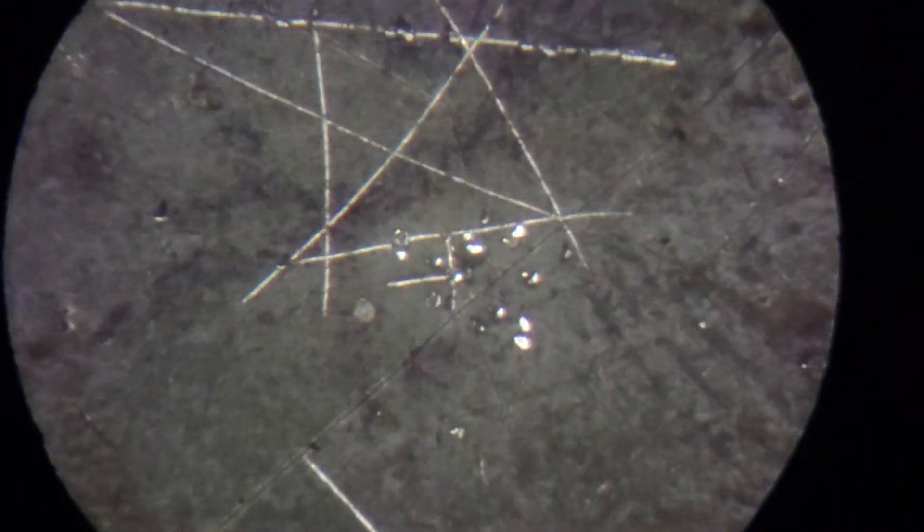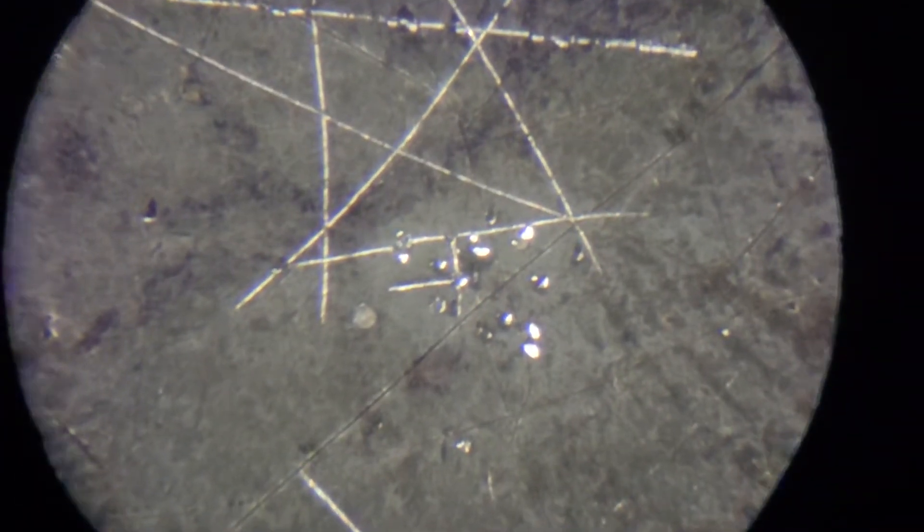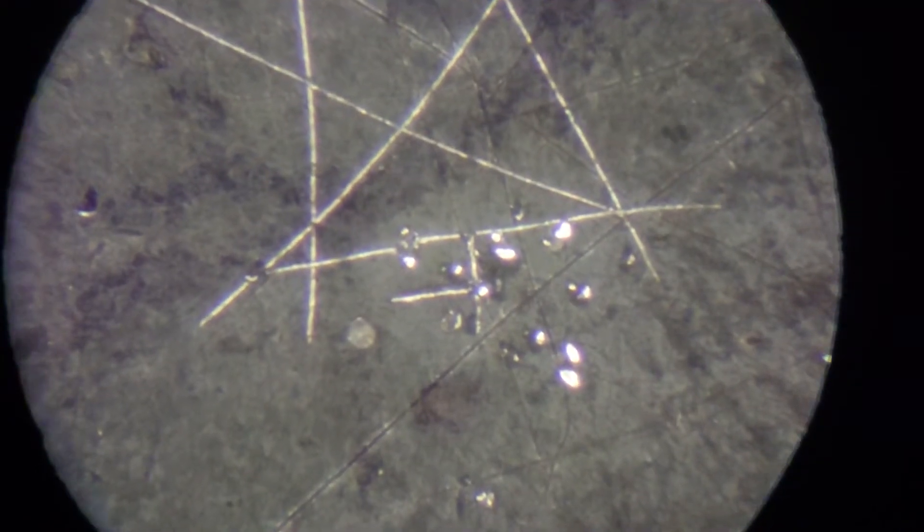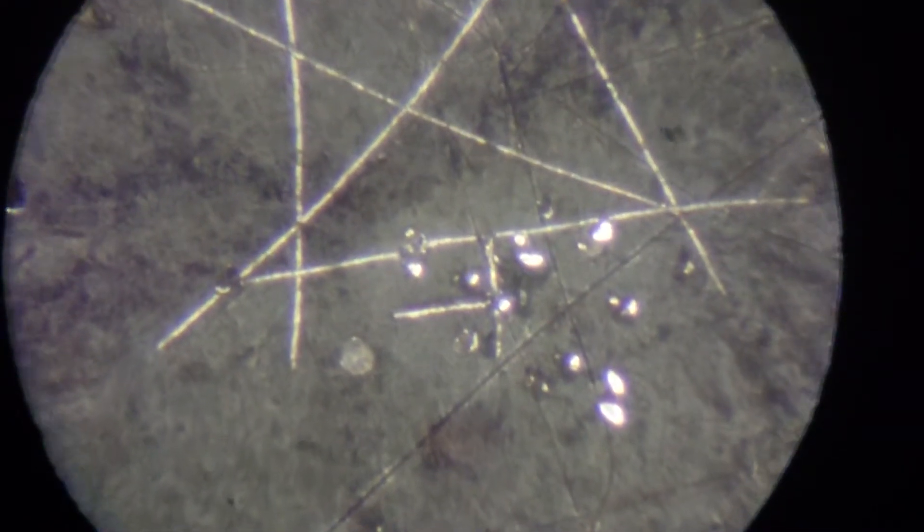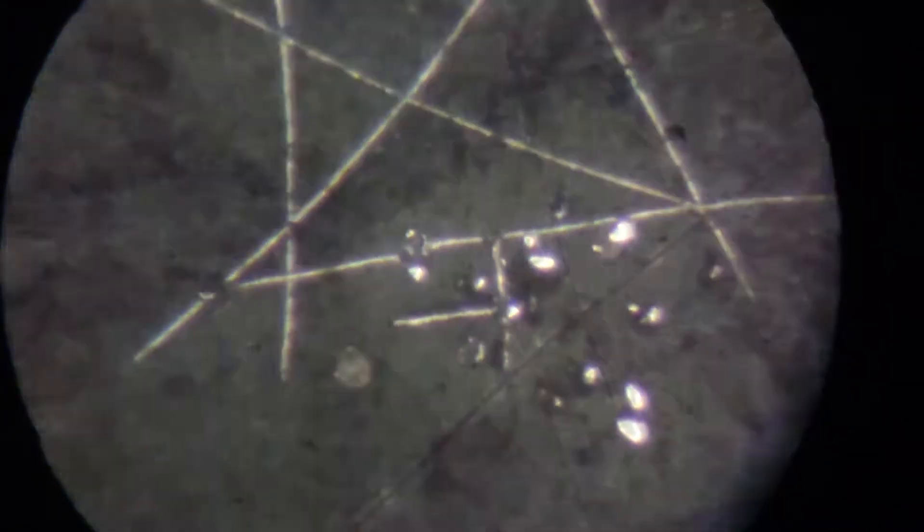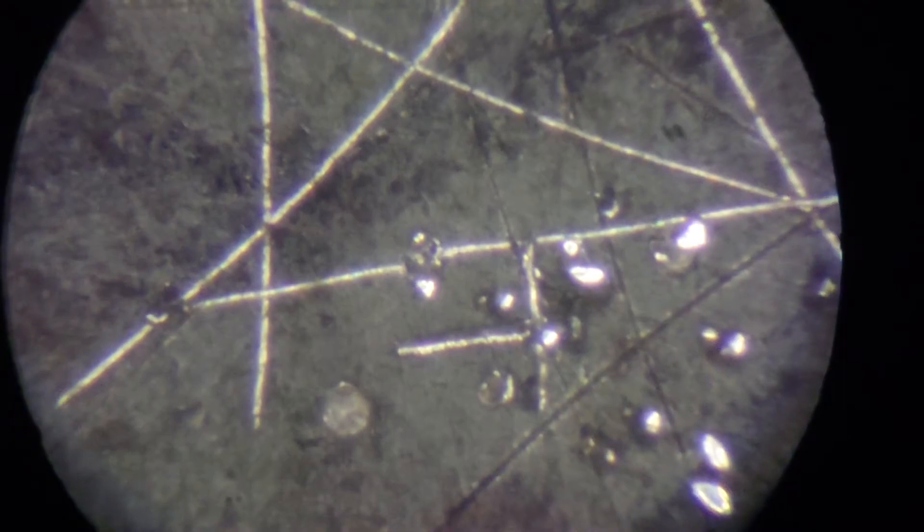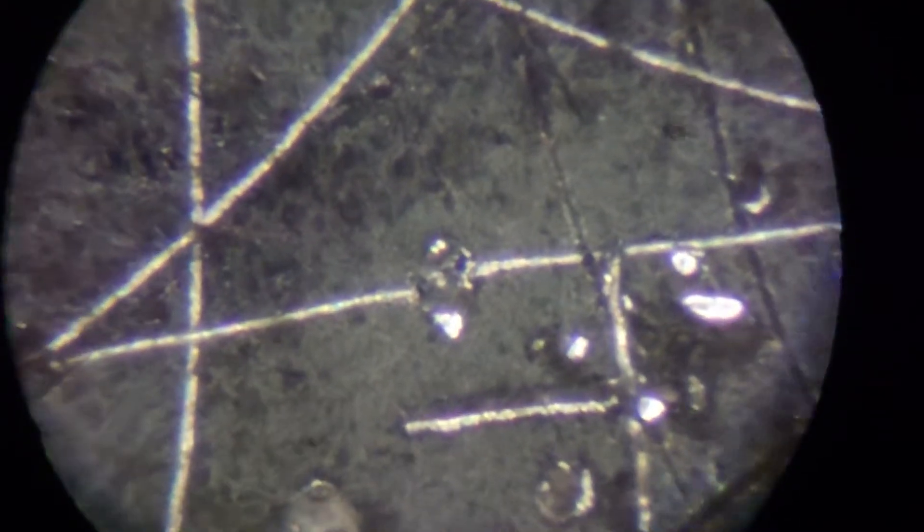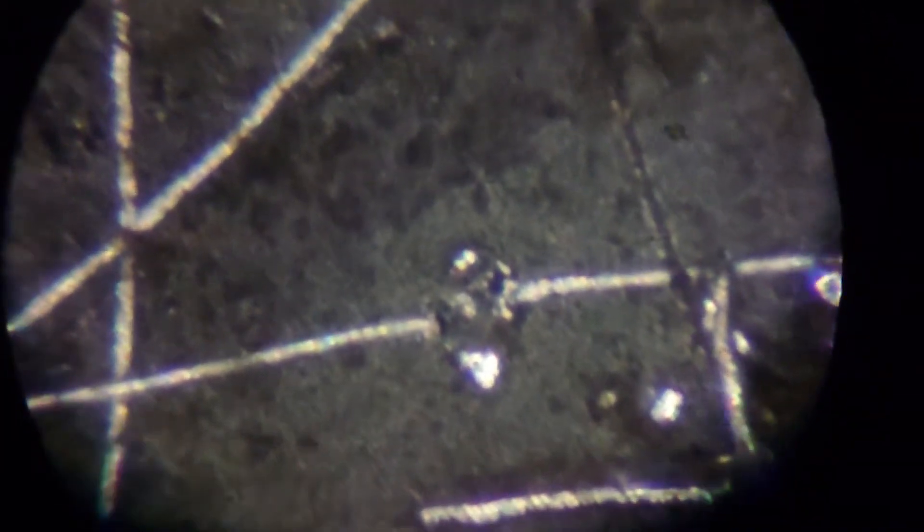Collimation is perfect. Now let's change zoom to the highest position. Middle of the zoom - left channel, right channel. And top of the zoom here. Let's check again - left channel, right channel. So we got ideal collimation here.